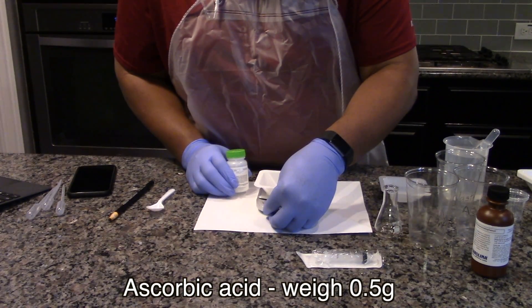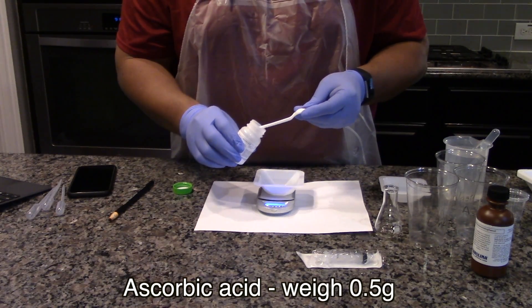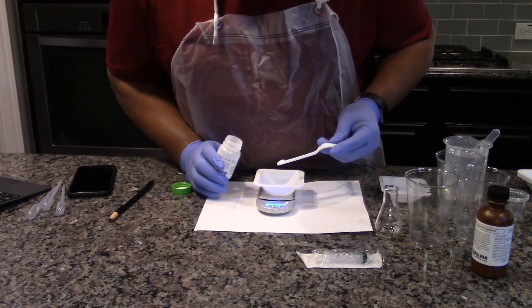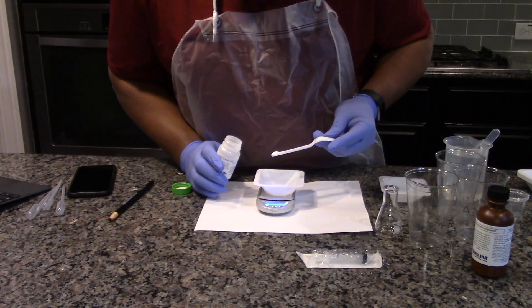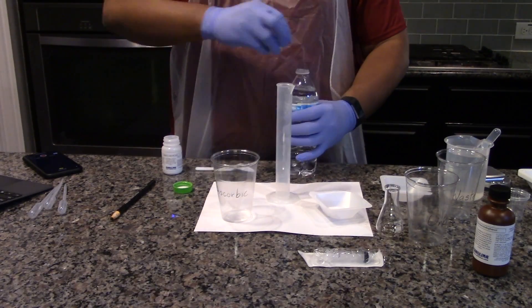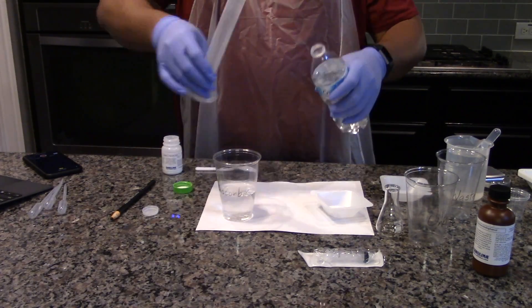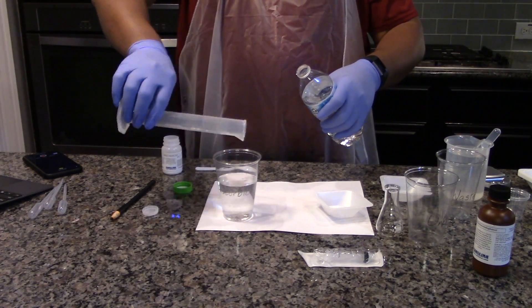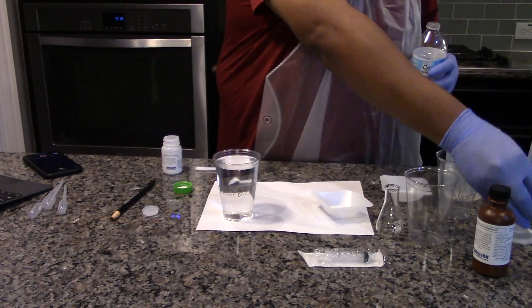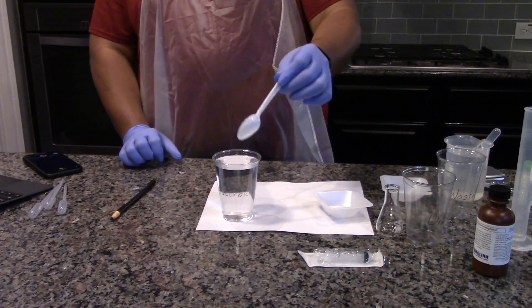Measure out 0.5 grams of ascorbic acid into a tared weigh boat. Transfer the ascorbic acid to the 10-ounce plastic cup labeled ascorbic acid. Add 250 milliliters of pure water to the plastic cup and stir with the spoon until completely dissolved. Place a pipette with the ascorbic acid to be used with this solution.